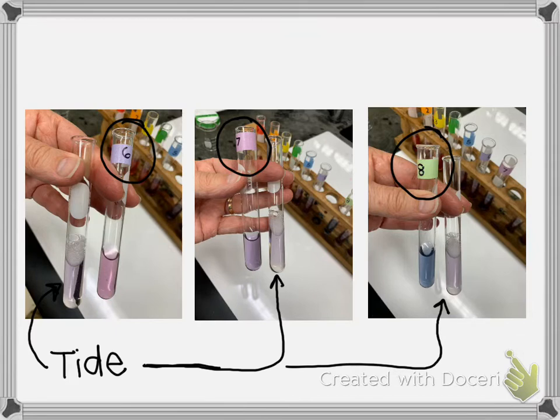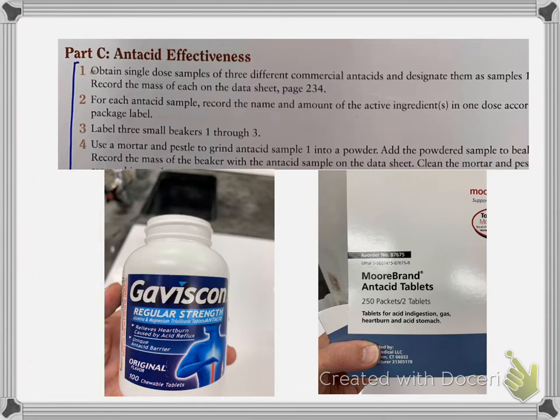And so this is part B, is just learning how to use, well, 2 things. It's kind of revealing about the pH of different things that are around us. And then the second thing is learning how to use a reference scale to determine information, like in this case, pH. And so then we have part C of this lab, and the part C is trying to determine how effective different antacids are.